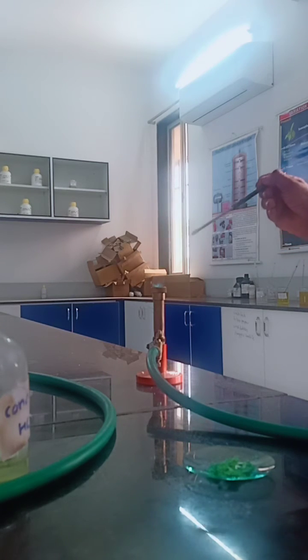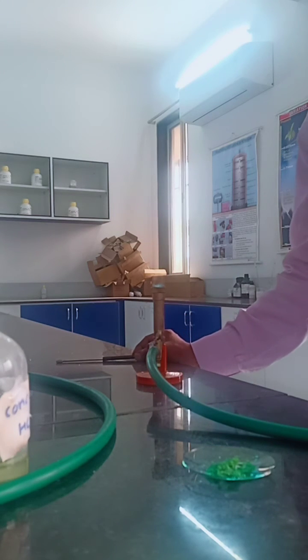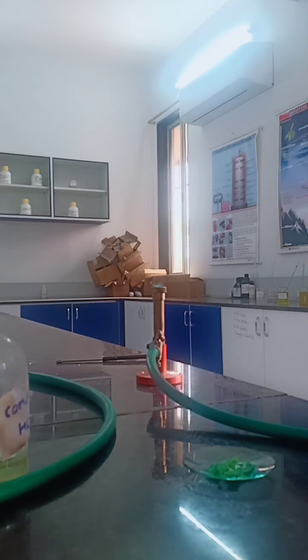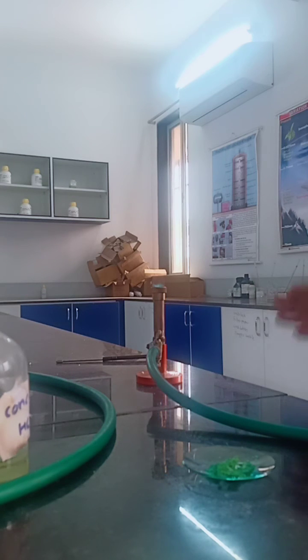Bluish green flame indicates the presence of copper ion in a particular compound. So this is the flame test to indicate or show the presence of copper ion.